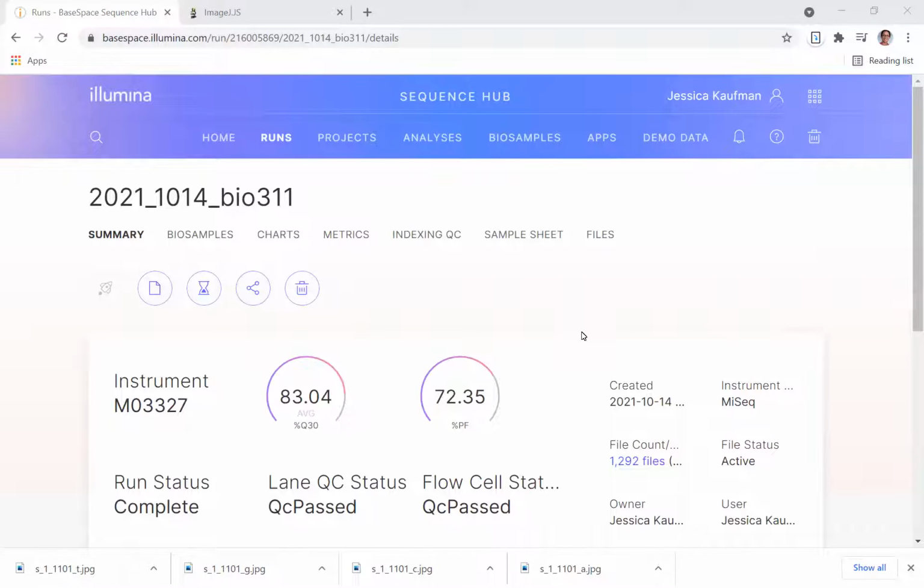We want to look at the actual images, the photographs that the Illumina sequencer took during each sequencing cycle to get an idea if there was too much DNA in the flow cell, just the right amount of DNA in the flow cell, or there could have been more DNA in the flow cell and we actually could have gotten more data from the run. You can analyze this figure in your lab by comparing it to the Illumina documentation on optimal clustering.